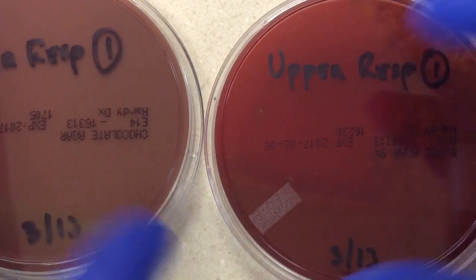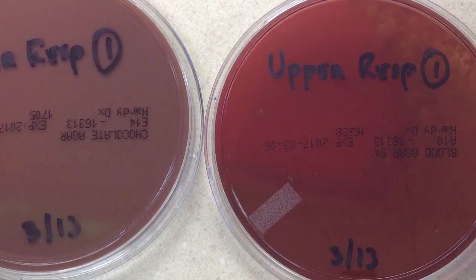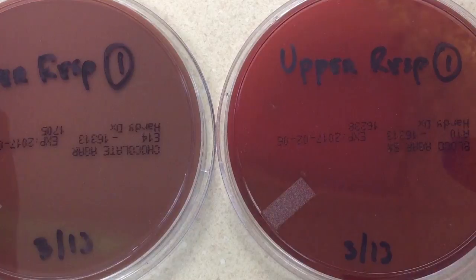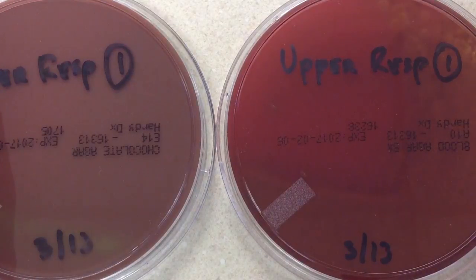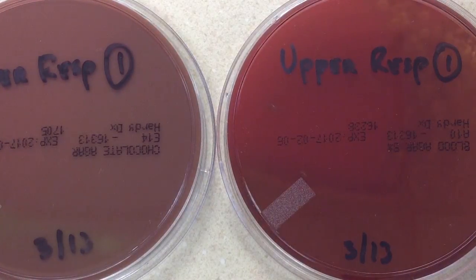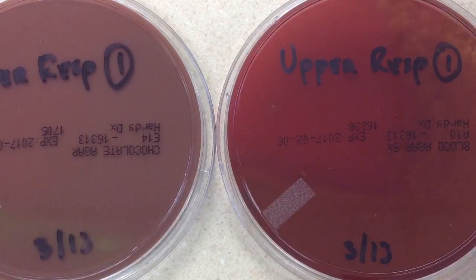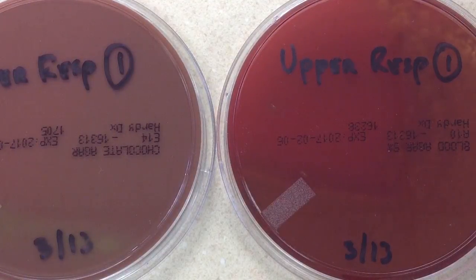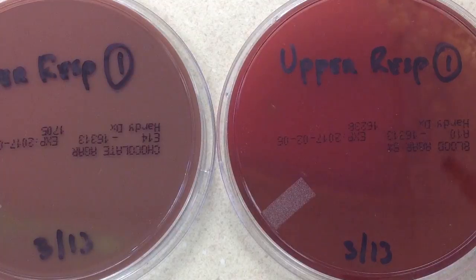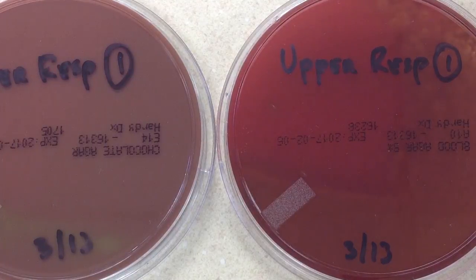I'm going to end this video here because usually I send out a preliminary report, but at this point I can't send any preliminary report because I haven't done my gram staining yet. As far as the workup on this particular culture, gram staining is the next step I'm going to take.